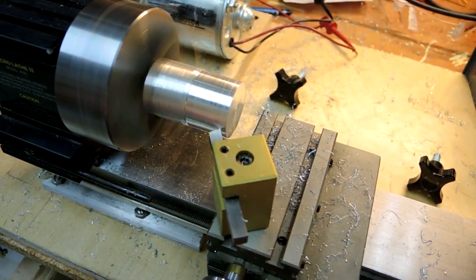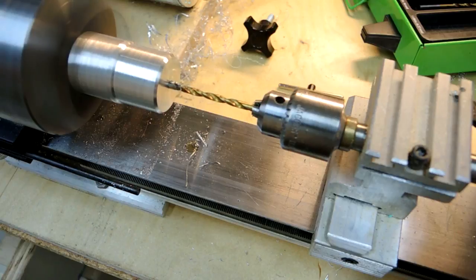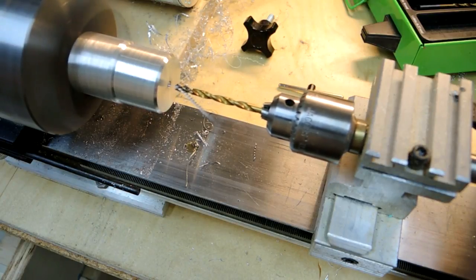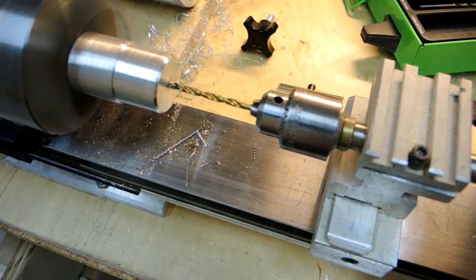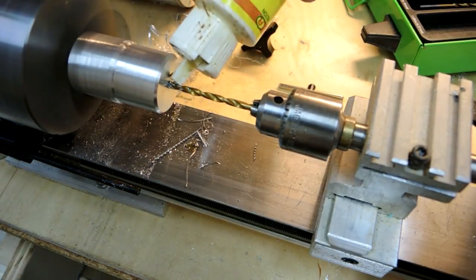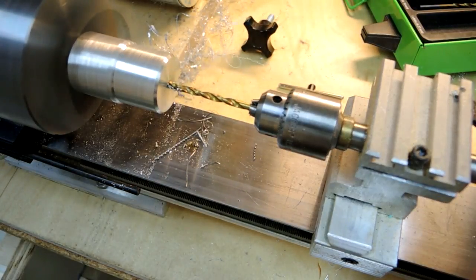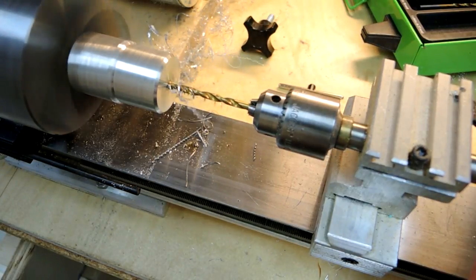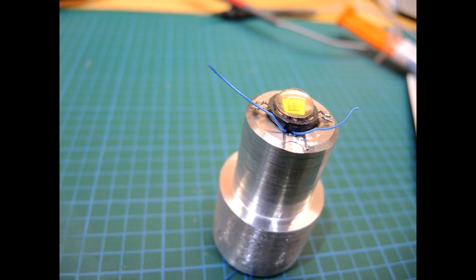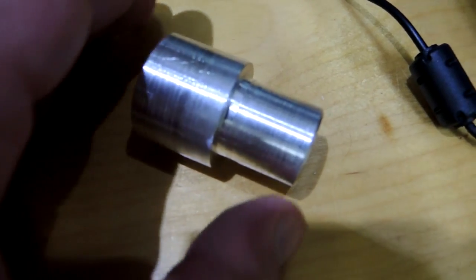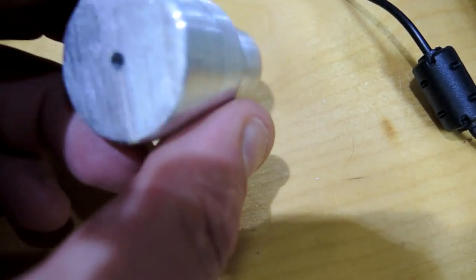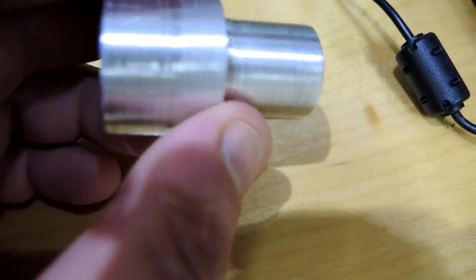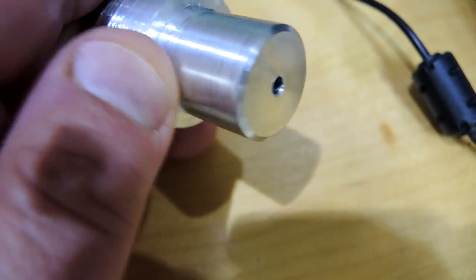Next thing up was to use a tailstock and I chucked up a drill bit and I put a hole through the center of it to pass the electric leads through to the outside. Then I took a file and I filed off a groove basically so the wires could pass through because I need the LED to sit flush. And here's the final product. It was looking okay.